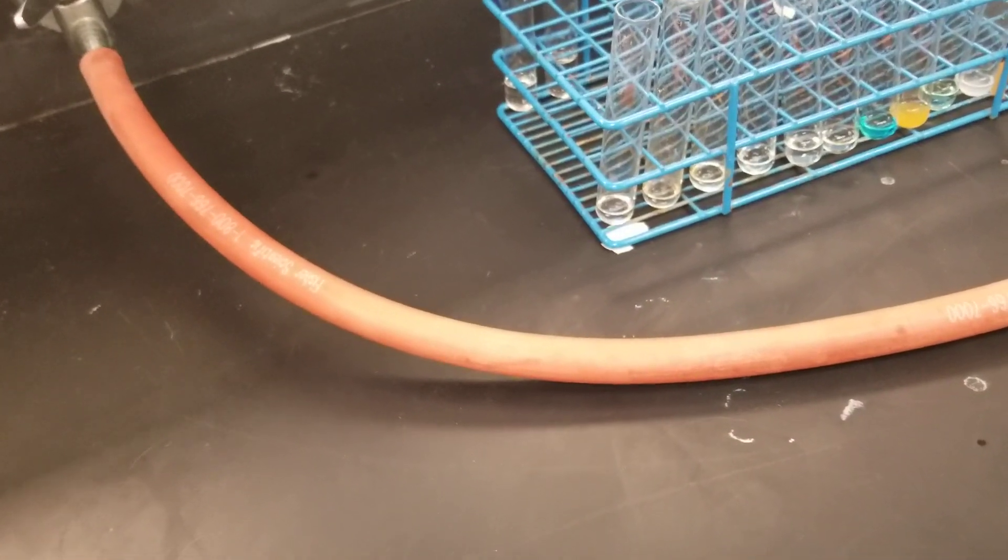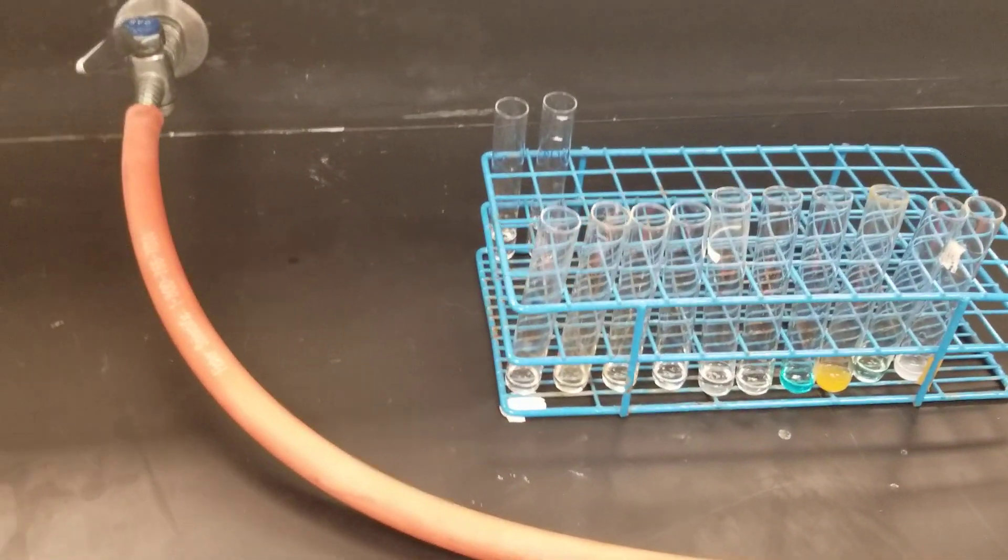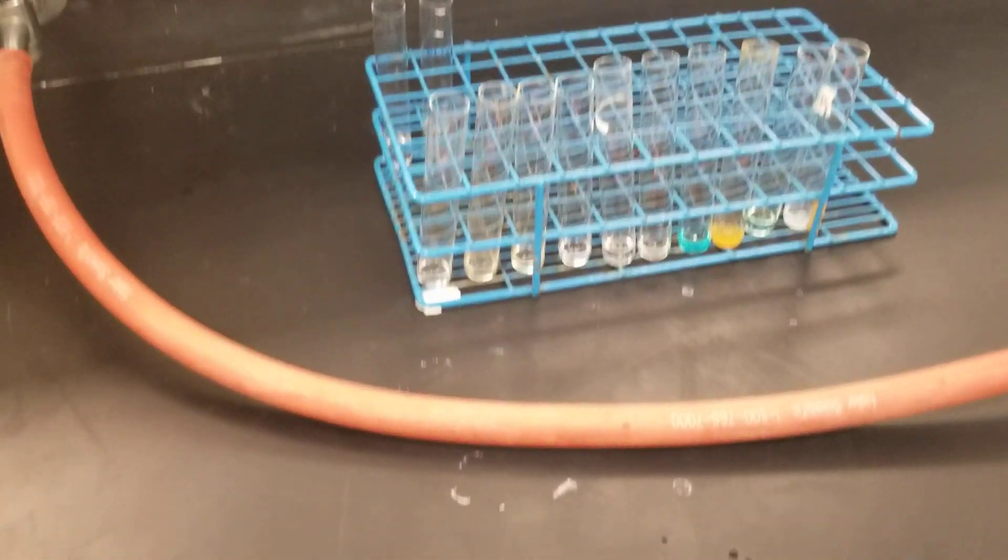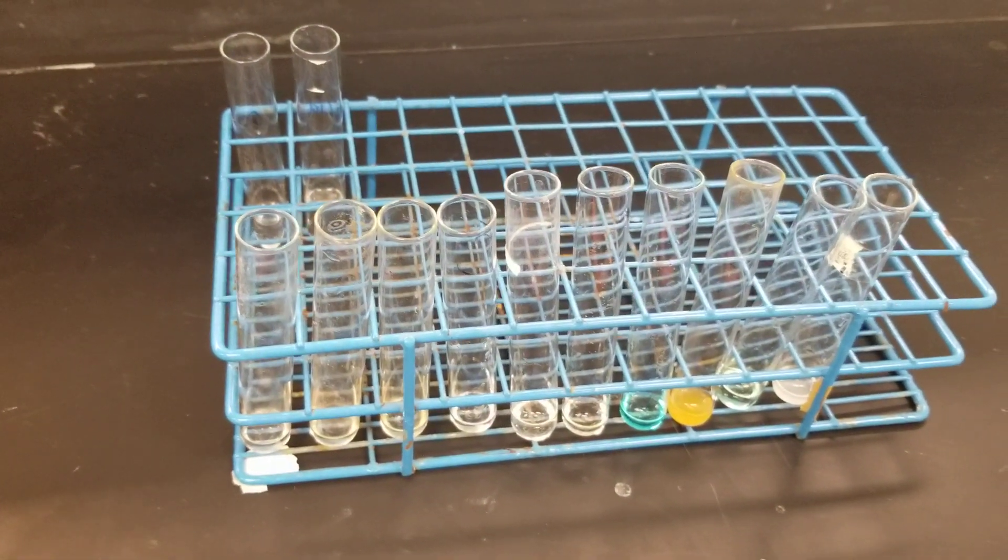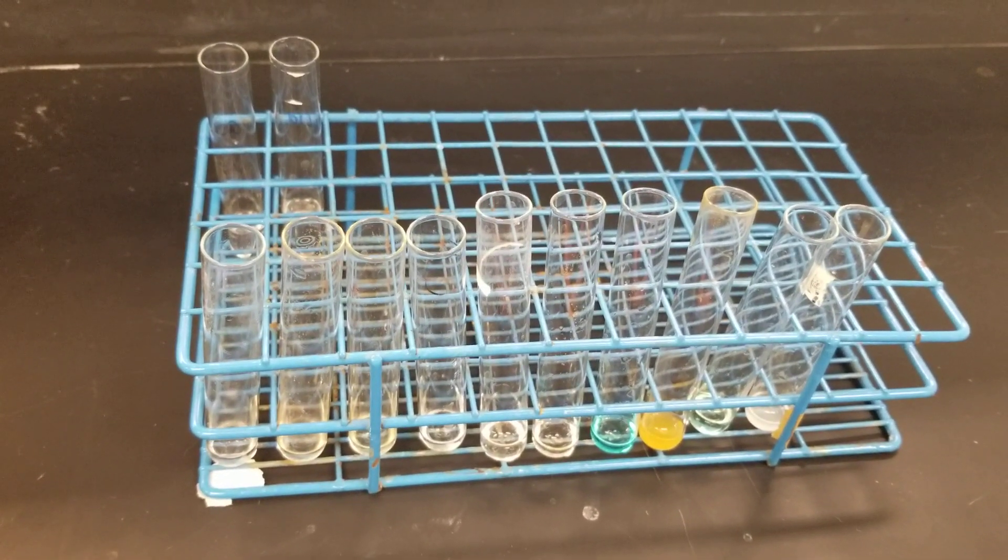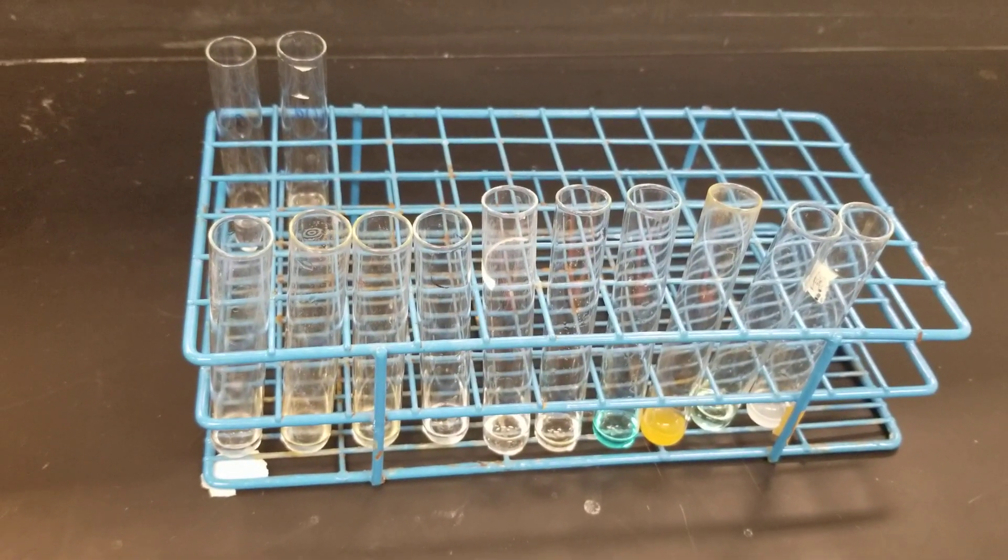Now I'm going to start the flame test. I already have 10 drops of each solution in all these test tubes, and they are arranged in sequence as in the manual. The first one is lithium and the last one is zinc.